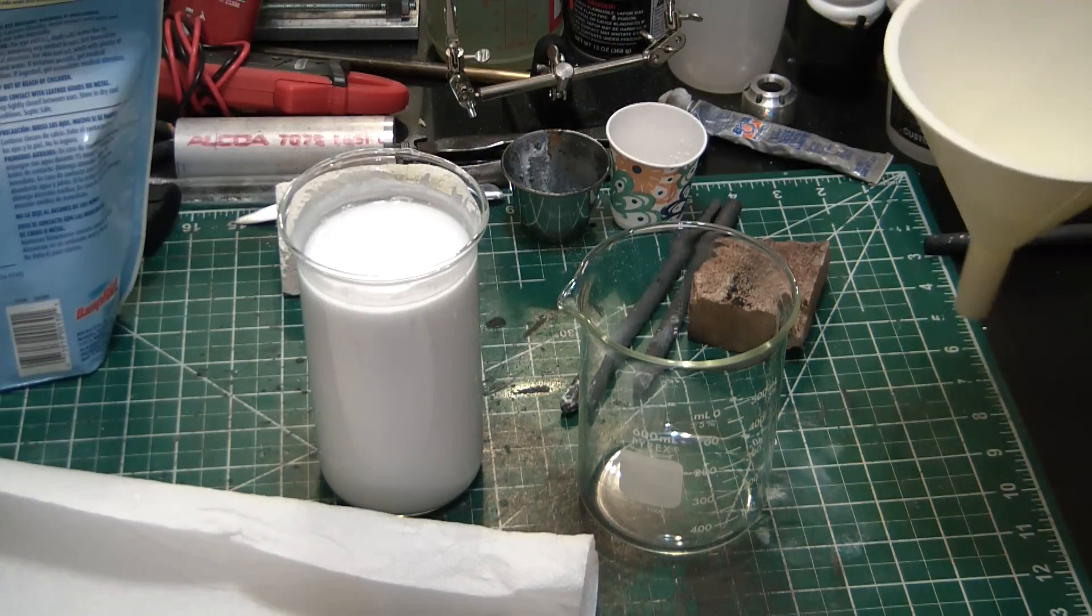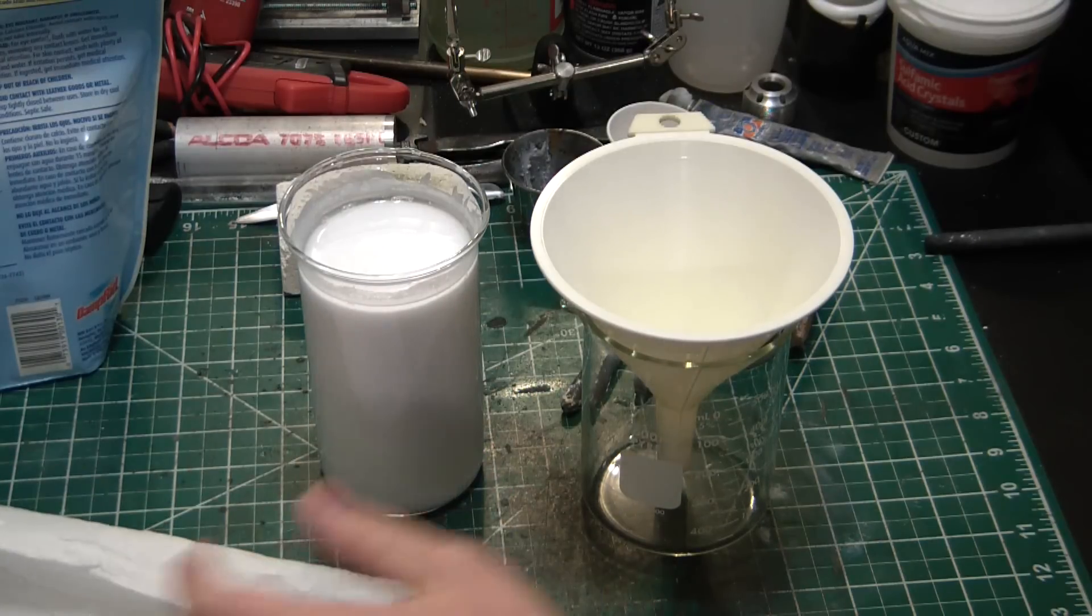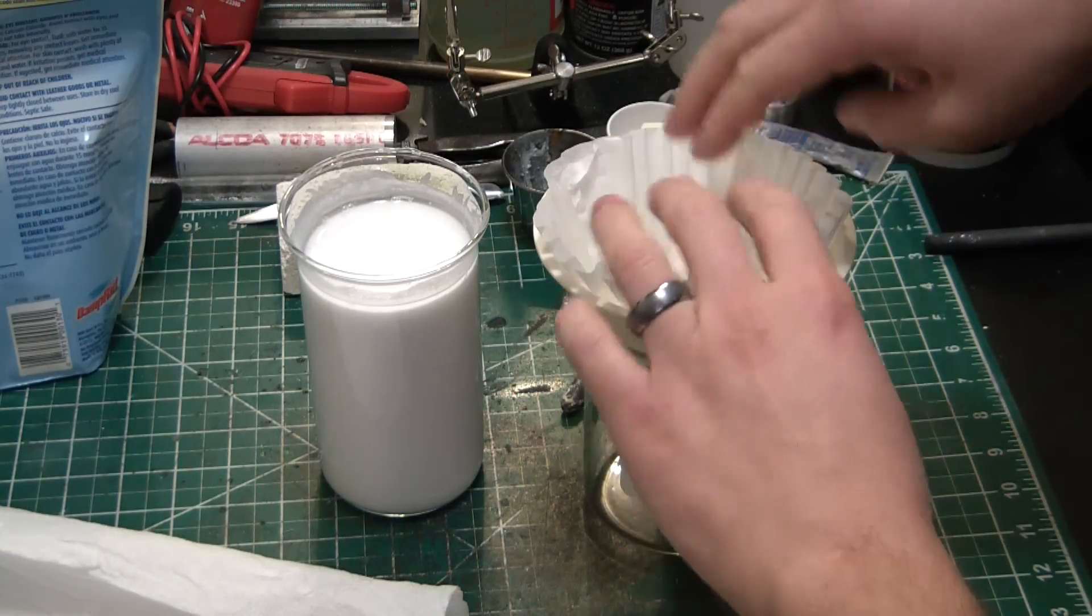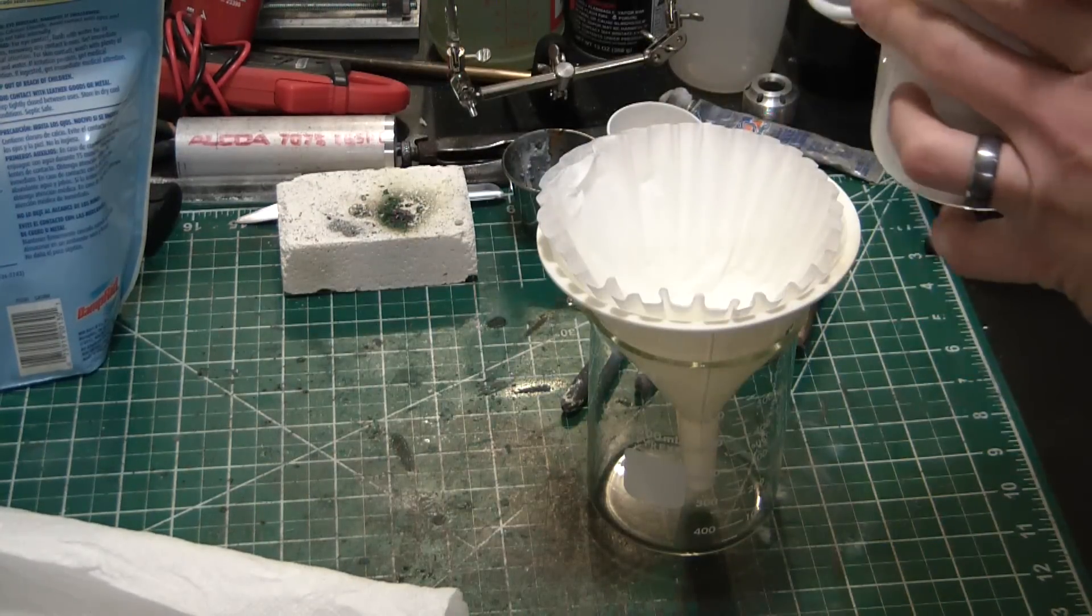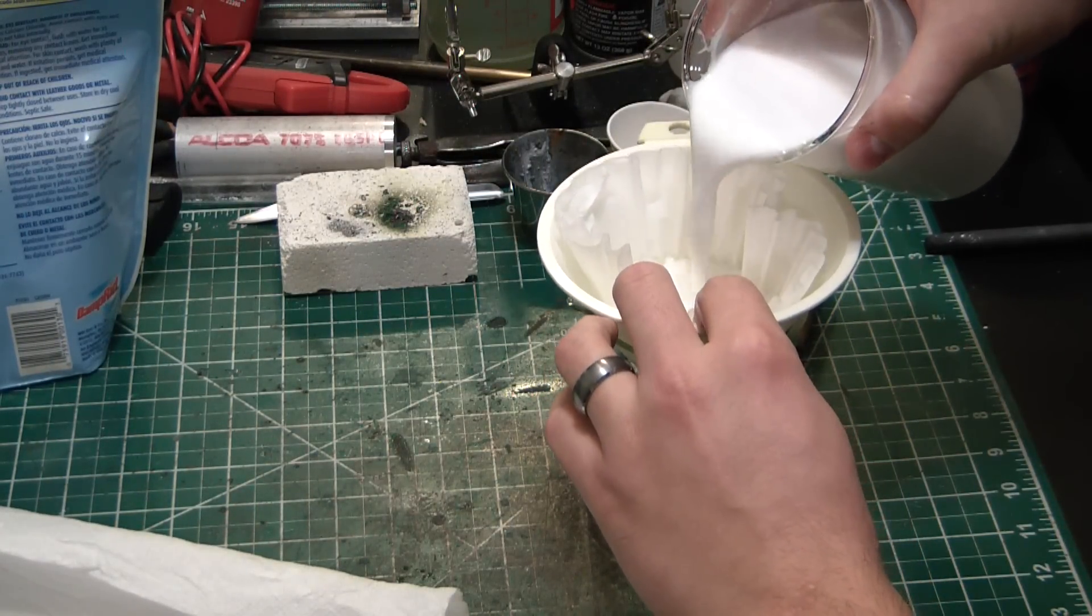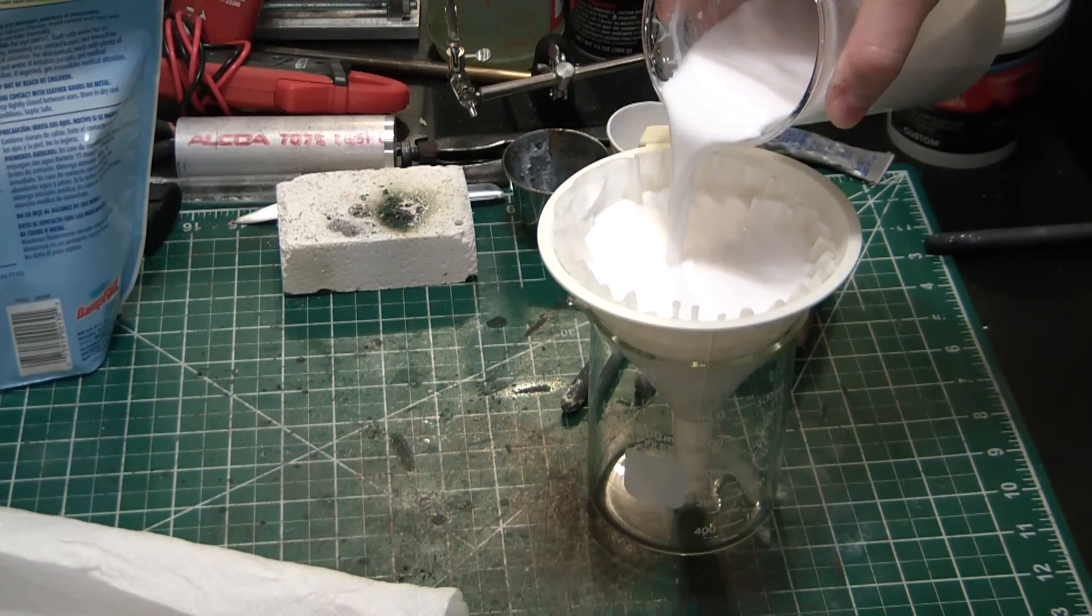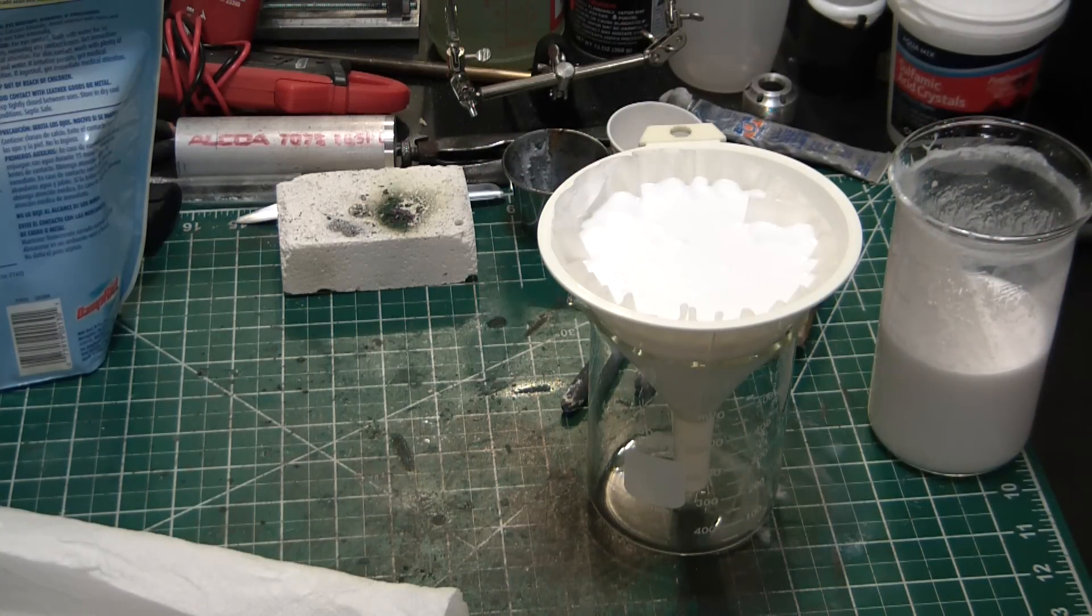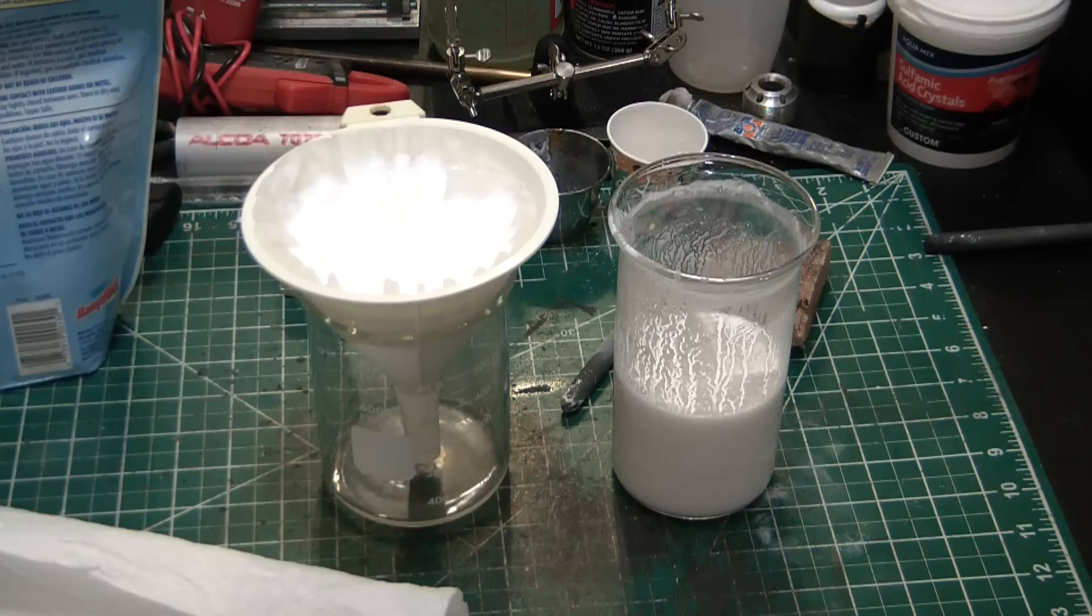Well, as usual, nothing ever goes to plan. I was hoping this would settle over the course of an hour or two. It has not at all, so I'm just going to set up for filtration, which in itself should be a lot of fun. This is going to take forever, but it should be hopefully a little faster than waiting for it to settle. Luckily you guys don't have to suffer through this whole slow-as-hell process. We will skip ahead to when it's done.